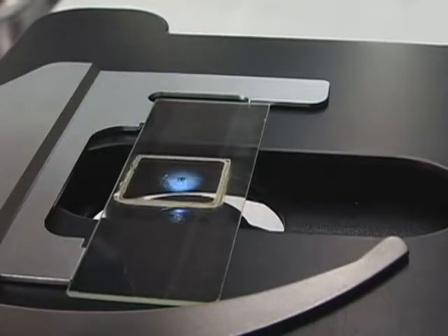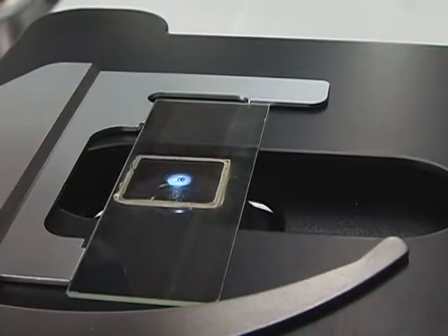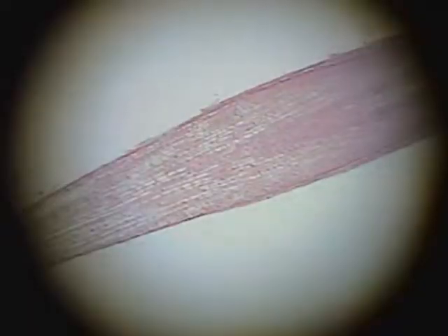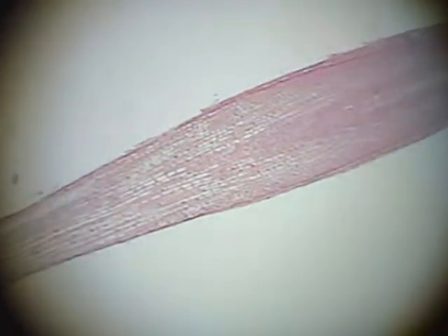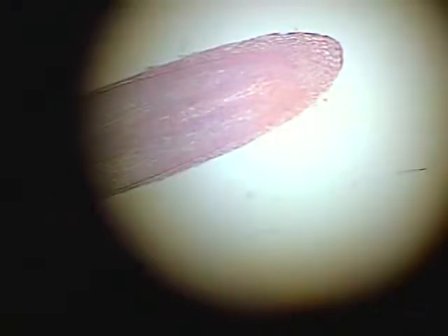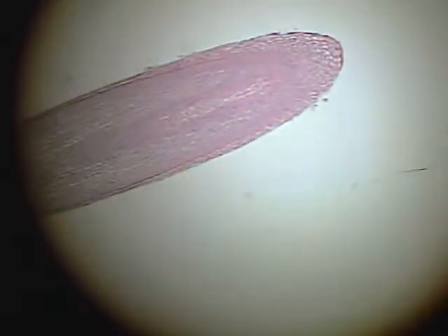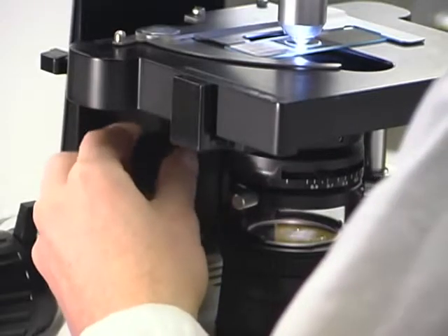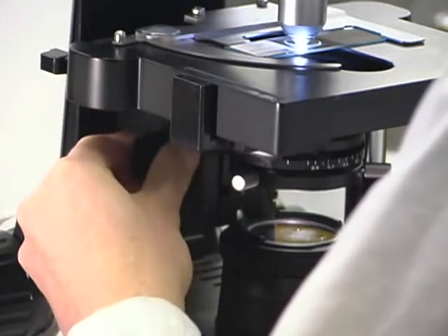Start with the condenser up nearest the microscope slide. Close down the iris diaphragm and adjust the mirror or lamp so that the circle of light is in the center of the field of view. Then open the iris diaphragm just until you cannot see the edges of the metal leaves of the diaphragm. If you cannot center the light, ask your instructor for help. Do not adjust any centering screws on the condenser. If you see the filament of the lamp bulb, move the lamp slightly forward or backwards, or move the condenser slightly up or down until the field of view is more evenly illuminated.